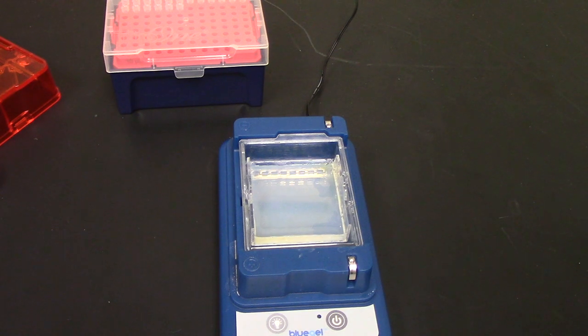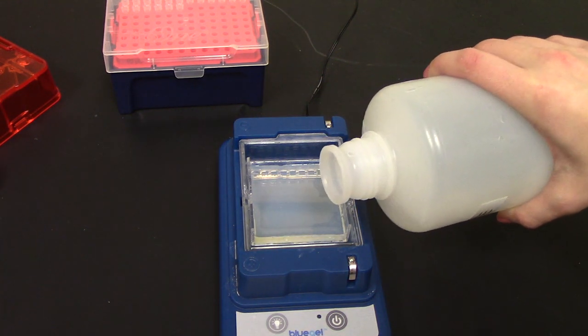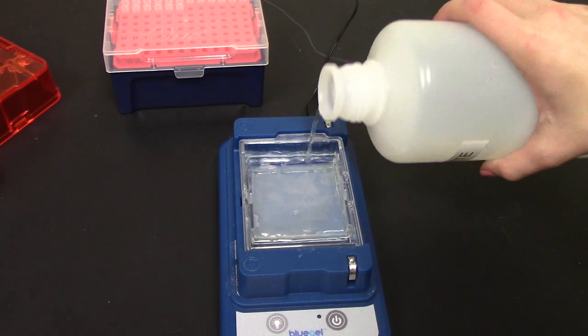Now I am going to add my buffer, which is 1x TBE, and I'm just going to want to cover my gel so I don't really need that much.